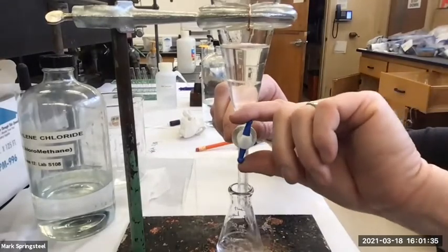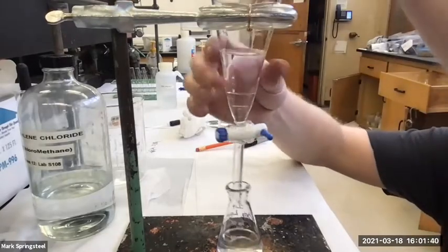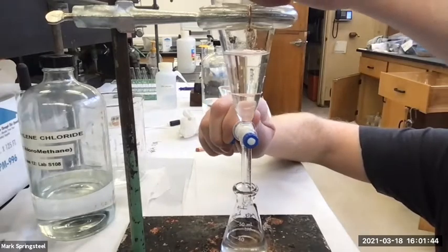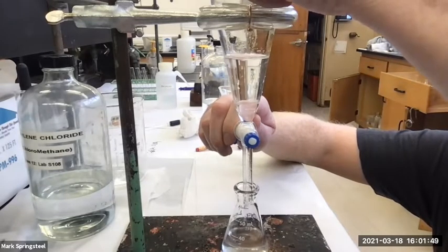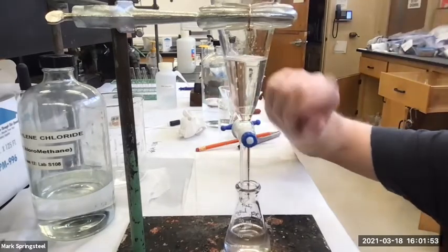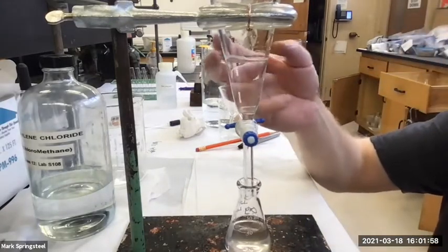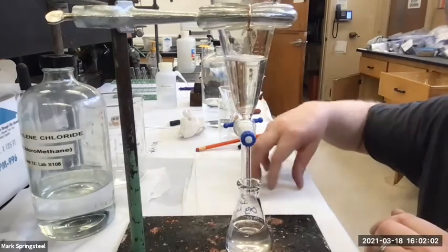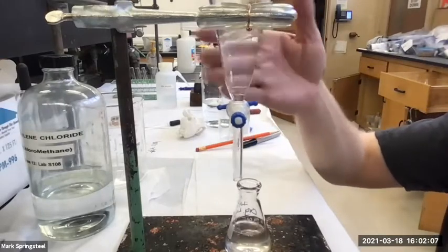And when it gets close, I'll stop it. Maybe I think it's better view video-wise if I turn the stopcock away. There we go. So now I can keep draining it. I try to separate the layers perfectly, but it doesn't always work out, but you do your best, you know. And now I still got some organic on the bottom. Before I proceed, what I like to do is tap the side of this. Occasionally there'll be a little bit of organic layer stuck on the surface tension of the water, like little bugs walk across the lake water because of the surface tension. I have some organic up there, so I'm gonna tap it a little bit.